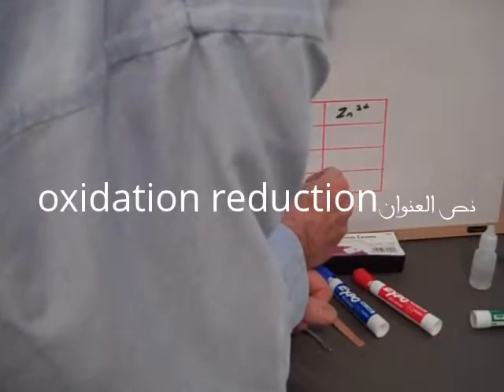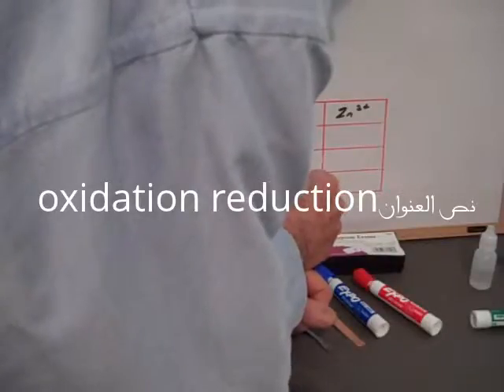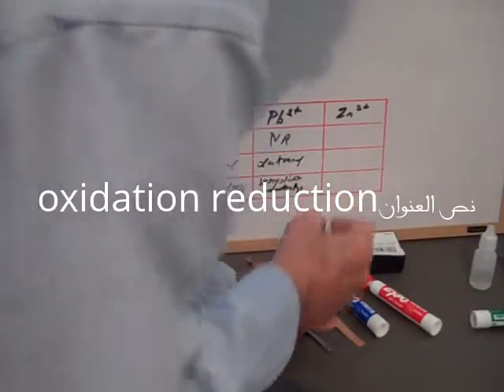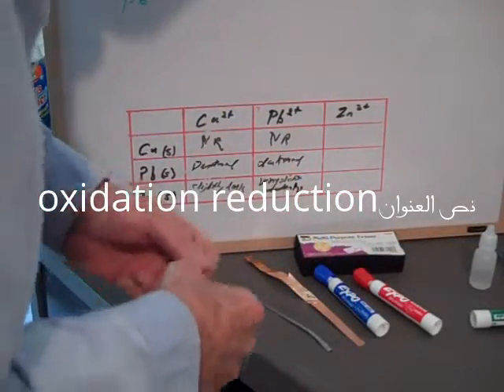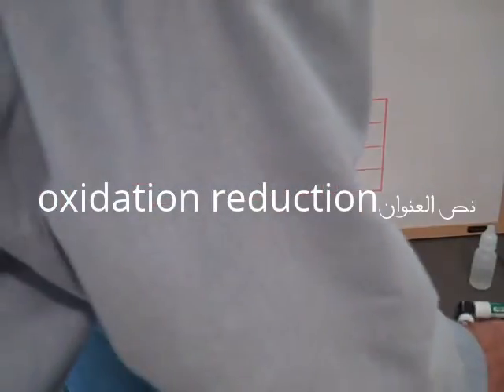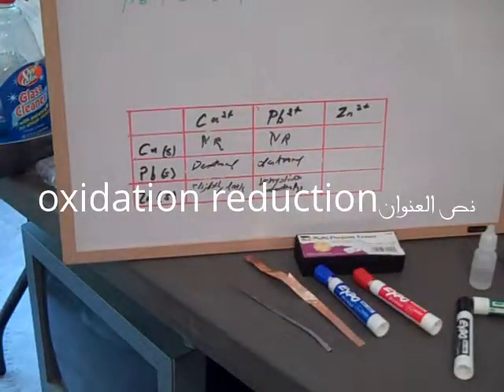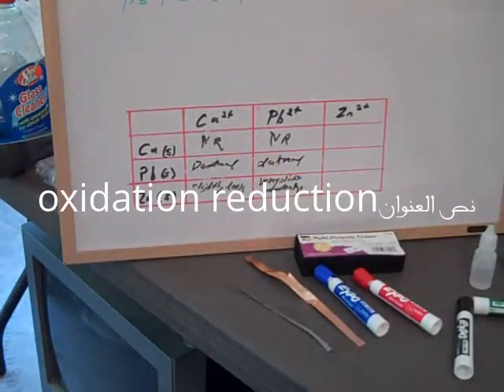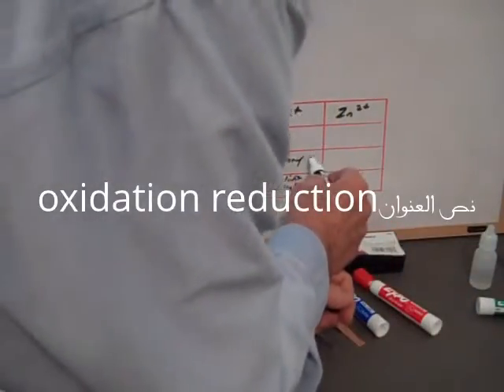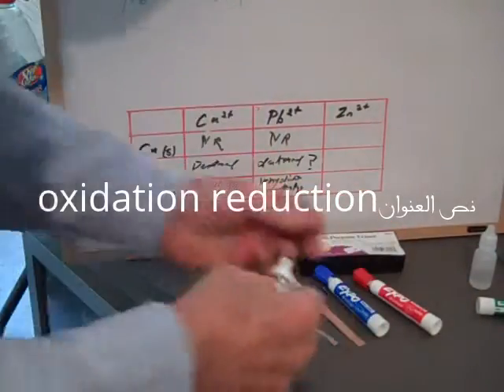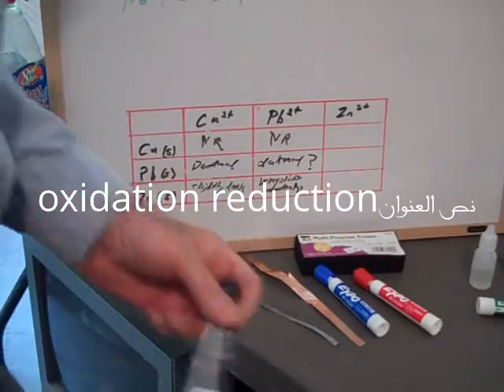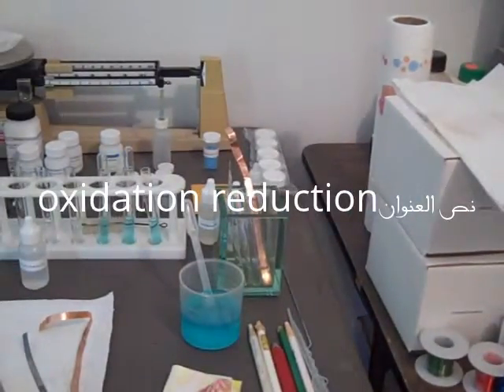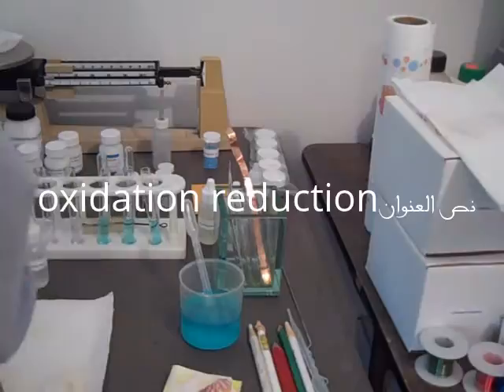Very slight darkening. Okay, we'll take a look at the other zinc nitrate—zinc chloride actually. I don't know why that happened. There's supposed to be no reaction here, so I'll put a question mark next to it. Remember that. I wonder why that happened. You always write down your exact observations. I want to look at the other one. I'm going to put these away.